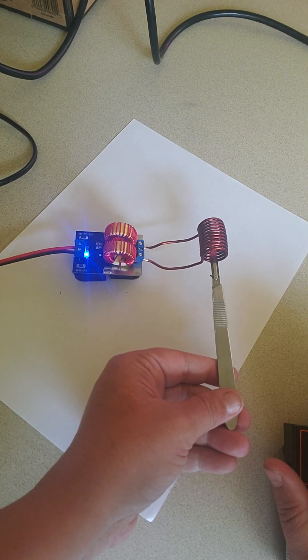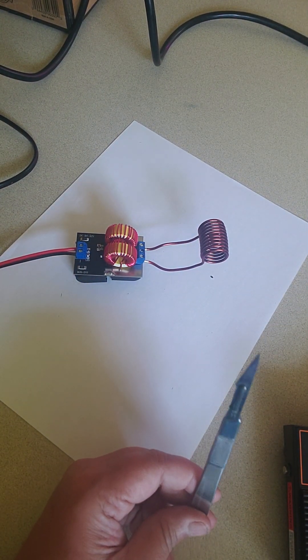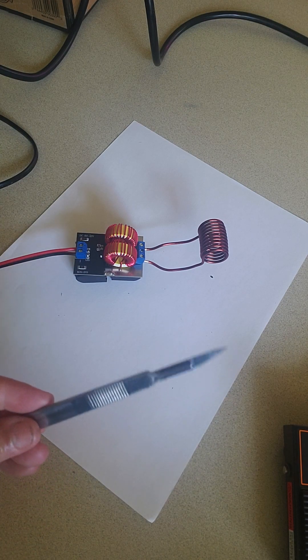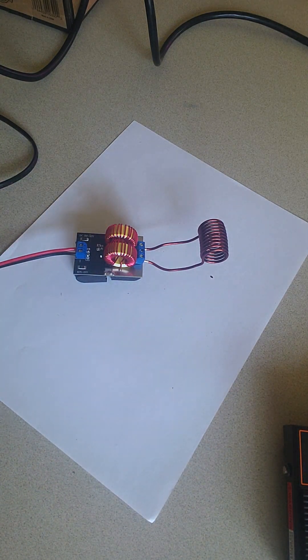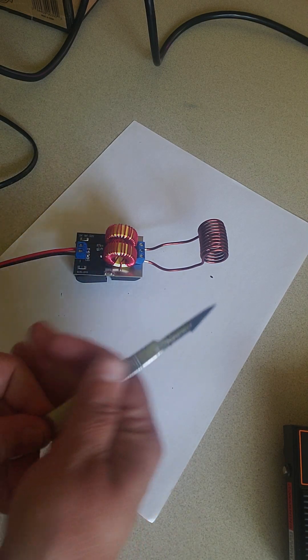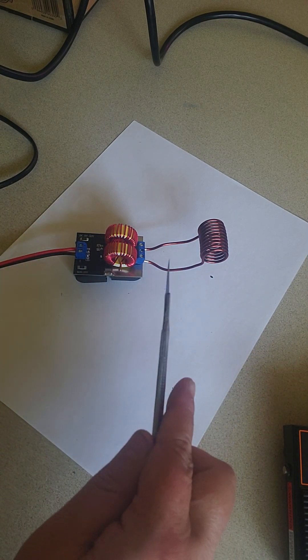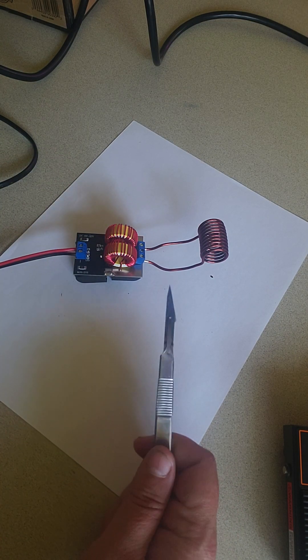You get that all in there — I don't know if you can see it on the camera, but it gets hot fast. That's how you make an induction sterilizer for easily sterilizing your blades at home. And it's crazy — no heat on the coil itself, this isn't hot. Normally my handle gets pretty warm down here, but it really focuses that heat on the blade itself.